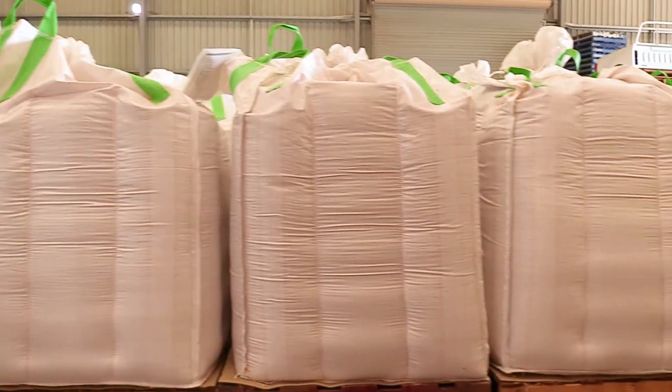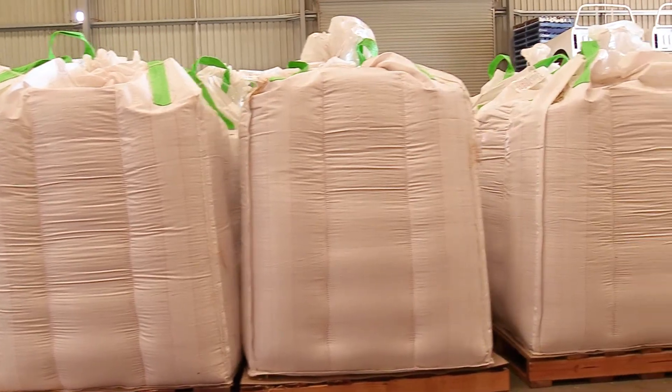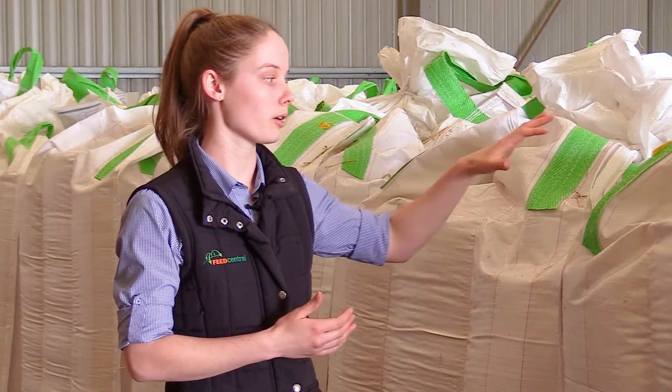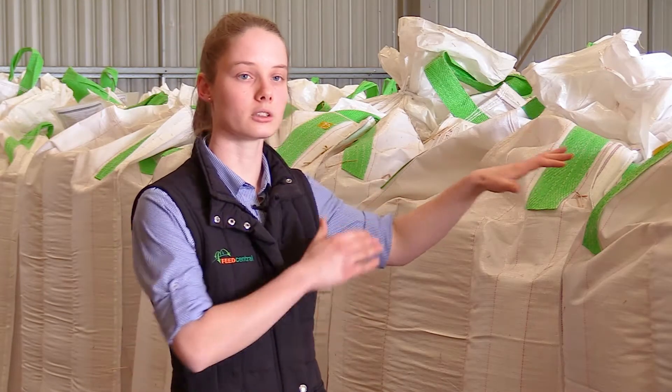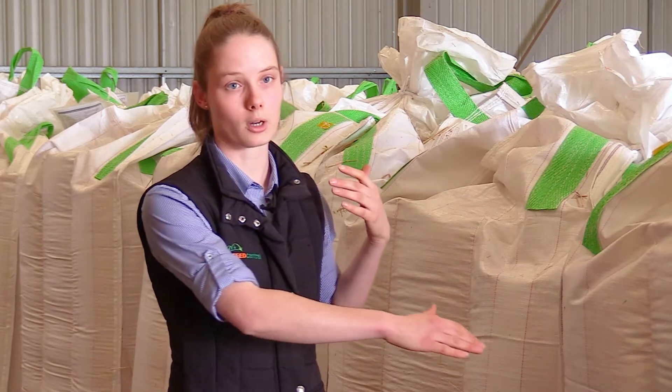To get a representative sample from a bagged product, again we use a grain probe, probing from the top corner diagonally down to the bottom corner.